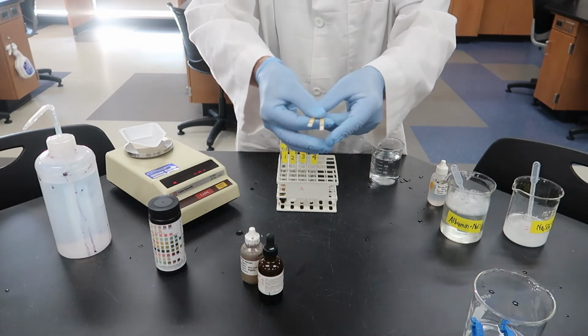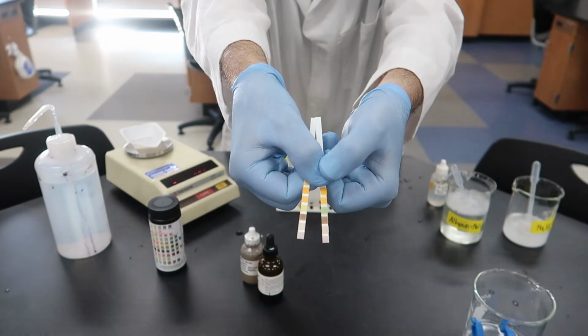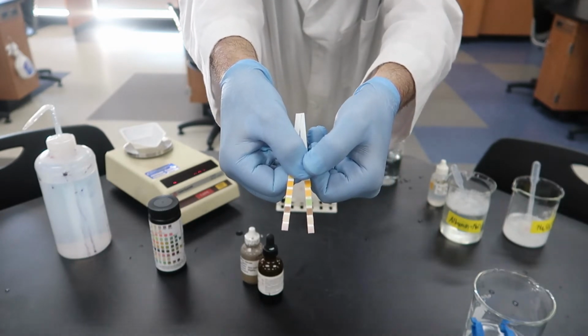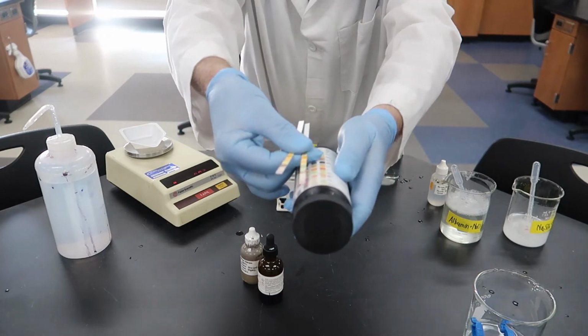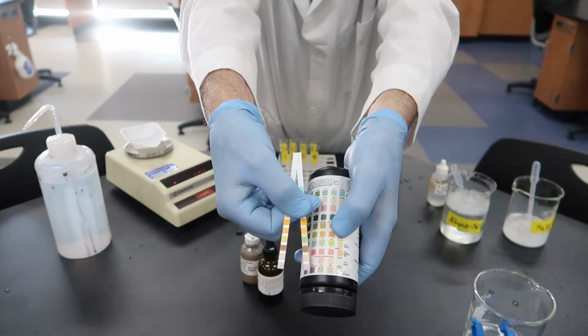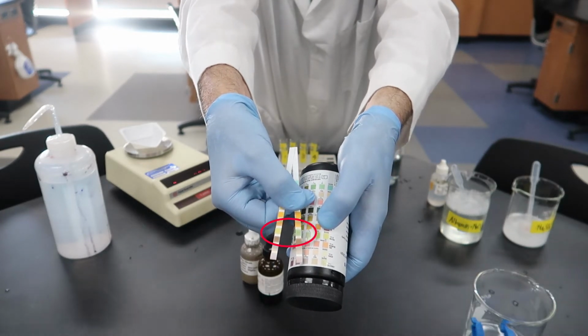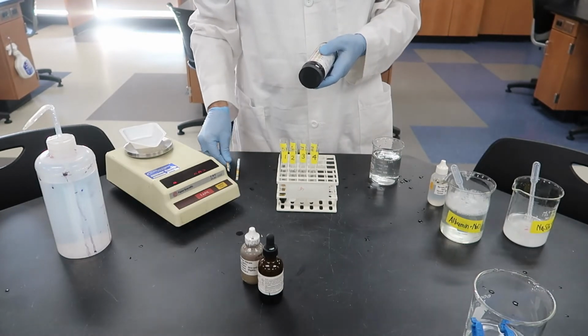Okay, with the magic of film editing, we're now ready to look at it. You can see there on your left, that one is the first one we did, and it is more yellow. The one on the right is the second one that we did, and it is more green. You can see the difference fairly well when you compare the 2 strips side by side.